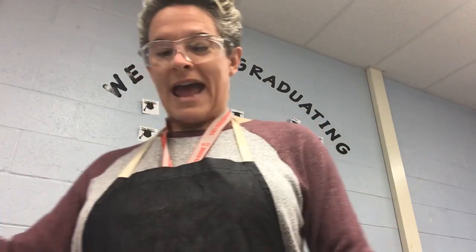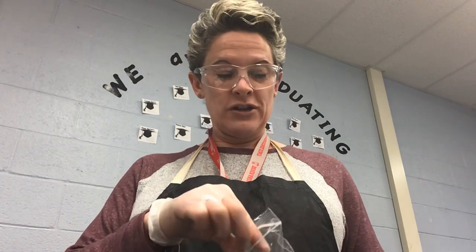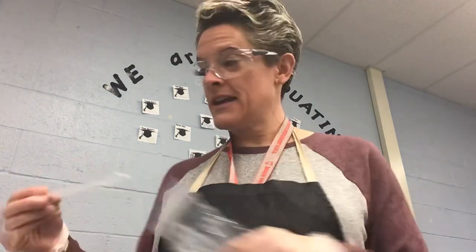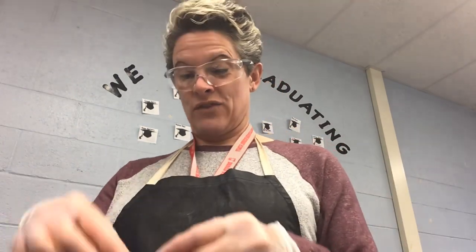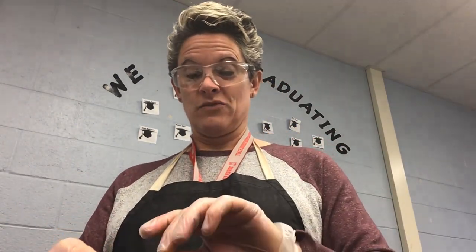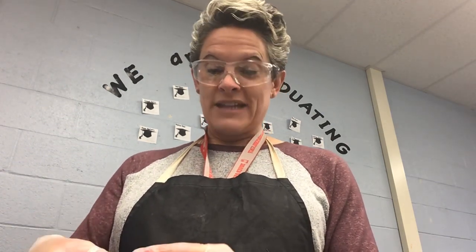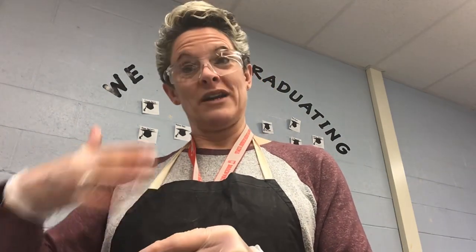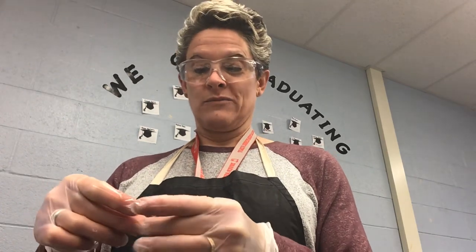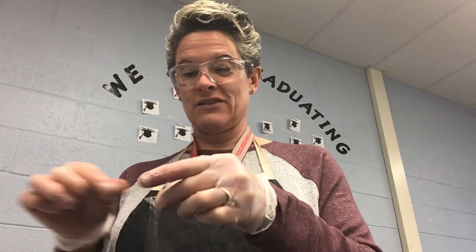What we're going to add to the dialysis tubing then is some starch and some glucose. Starch is a big polysaccharide, and we're going to assume that that's not going to fit through the pores of this dialysis tubing because it's too big. We're also going to put glucose, which is a monosaccharide, and we're going to hope that that does fit through the dialysis tubing and is able to be absorbed out of this dialysis tubing. If I rub this dialysis tubing between my fingers, it does open up.